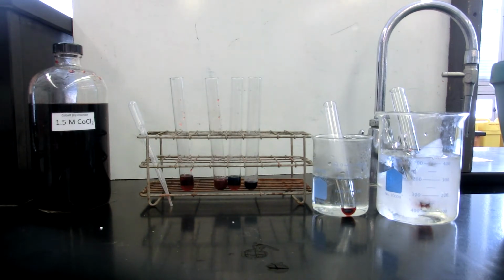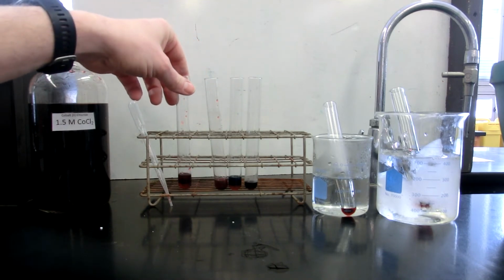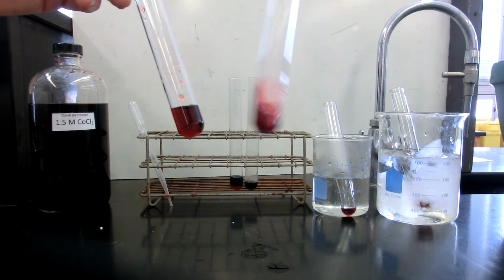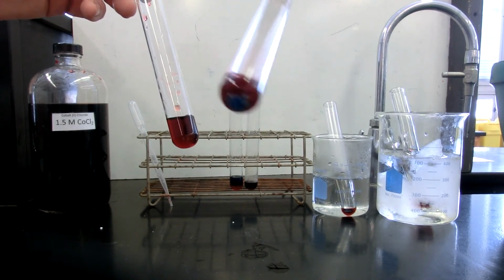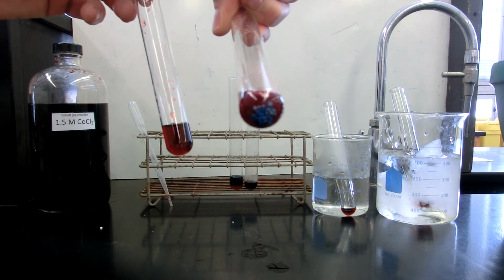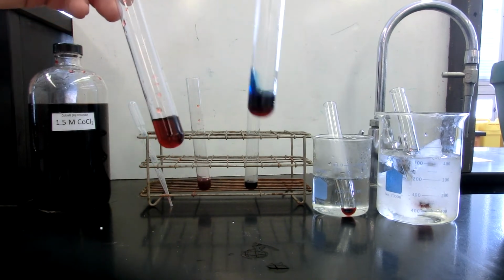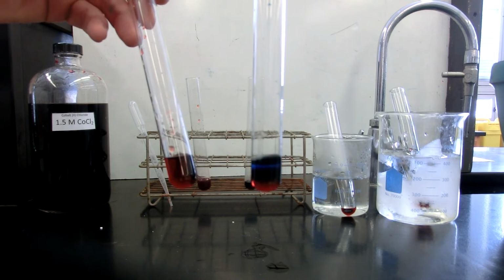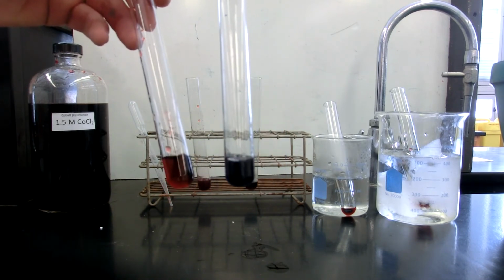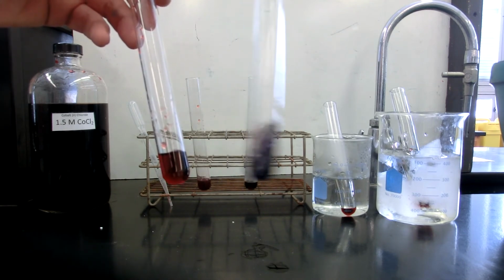So at this point, what we should be able to do is now compare what each one of those did to the equilibrium position. Here is the control, and here is the calcium chloride. You'll notice again the bottom of the container, you'll see that the crystals of calcium chloride have a blue tinge around the base of them. So now we have the control with the acetone. You'll notice there is a very strong cobalt blue color to the acetone added solution. It's now even on the purple side.